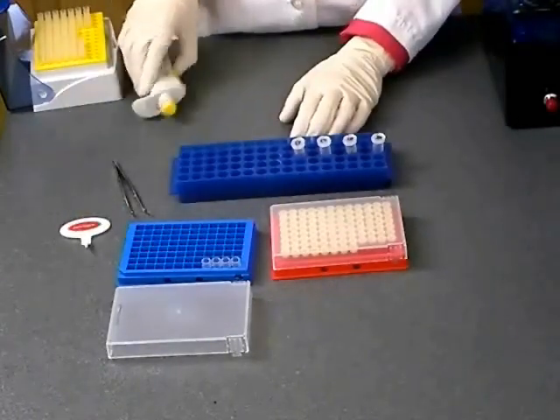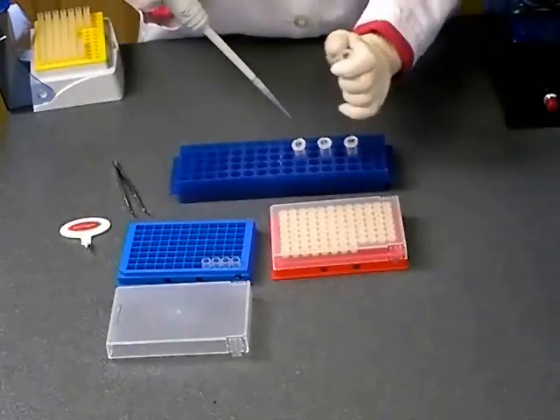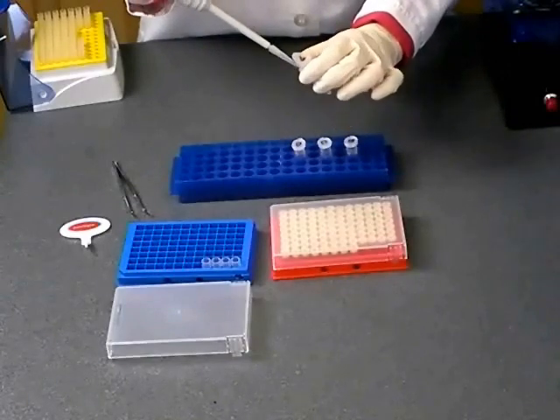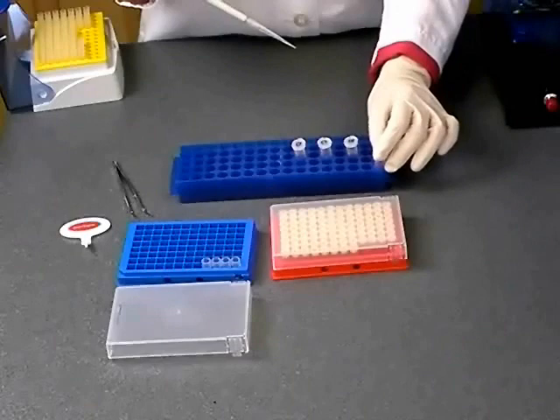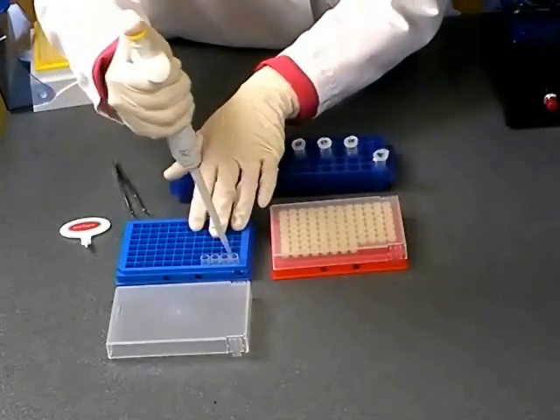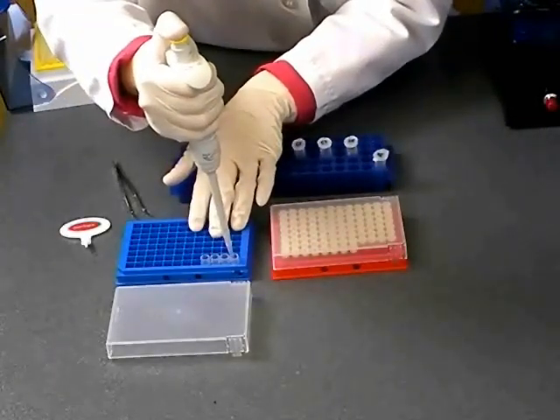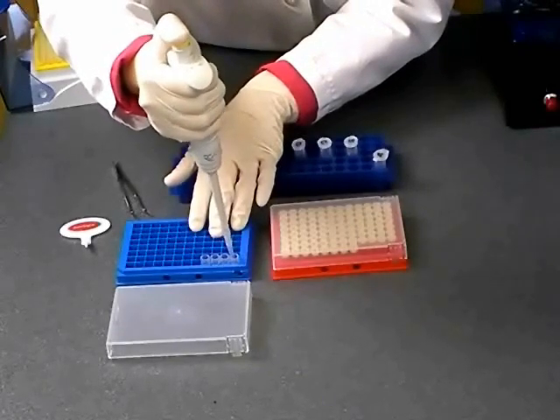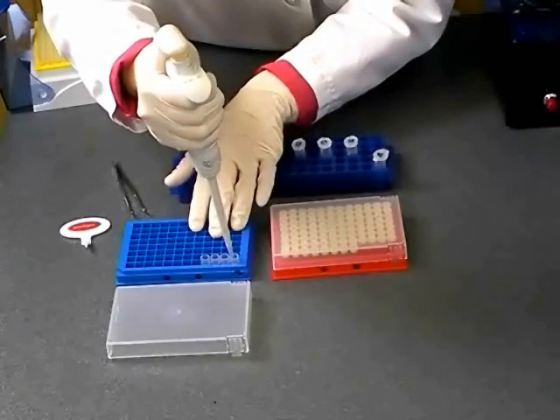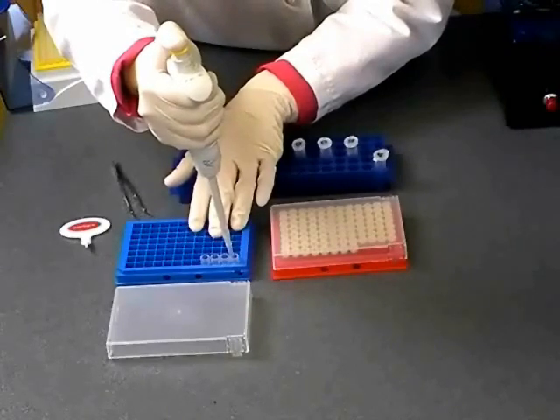Using a pipette, aspirate 20 microliters of your DNA in a well-mixed solution at room temperature and dispense into the bottom of the Gentegra DNA tube. Simply pipette up and down six times to mix your DNA with the Gentegra matrix. Ensure that your pipette tip is centered in the bottom of the tube to avoid splashing the DNA on the walls of the tube.